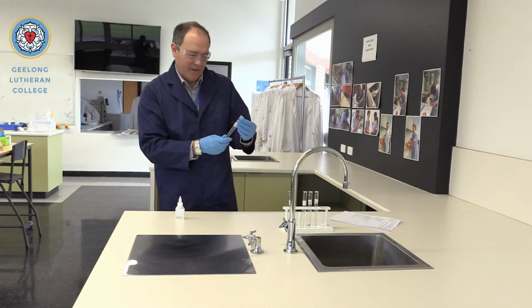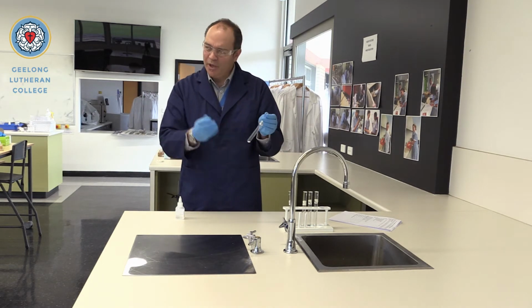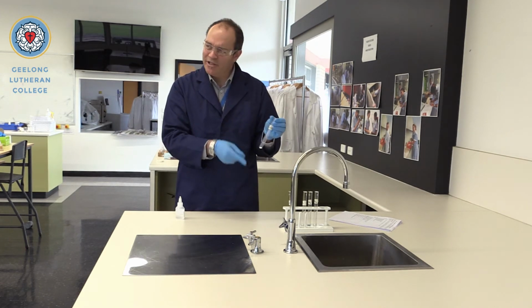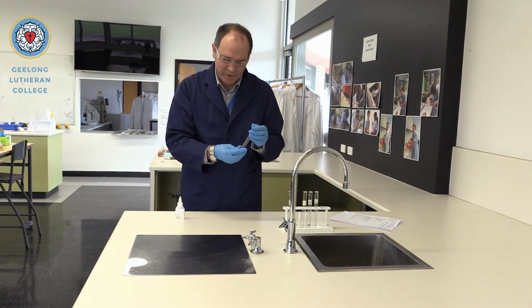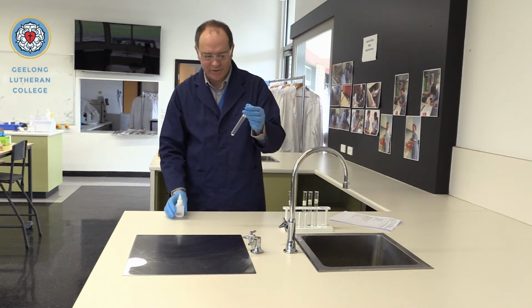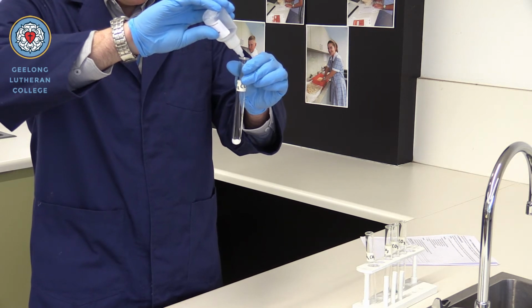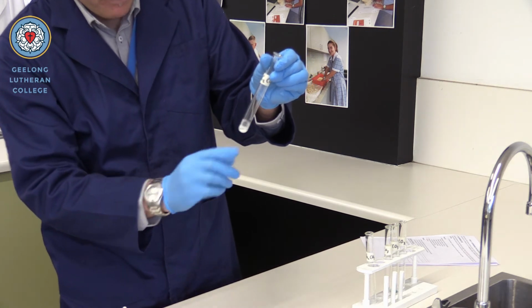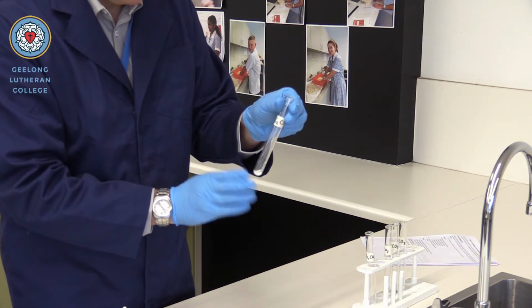So now the next one we'll be testing is potassium carbonate. You'll note that the cation, or the metal, is changing in each of these substances, but carbonate remains the same, and that's the one we're testing for. So we're just checking to see what happens when the acid is added to carbonate compounds. Keeping a close eye on this one. And again, same as the last time, vigorous bubbling occurred and carbon dioxide gas was released.